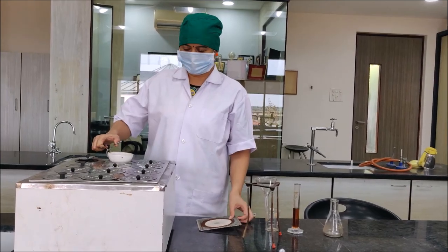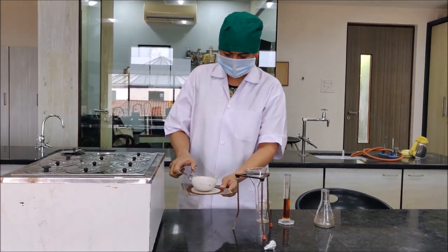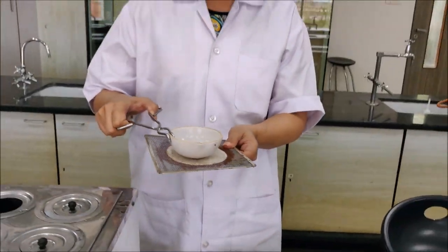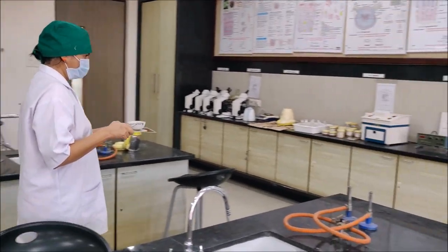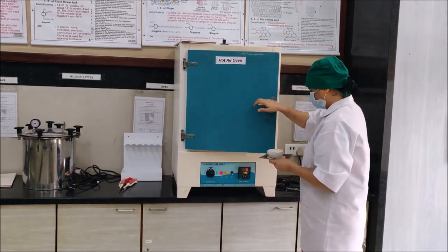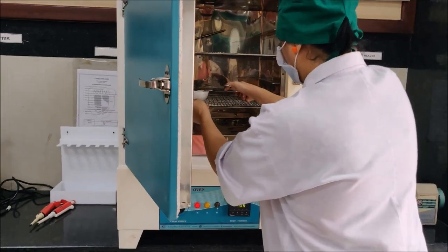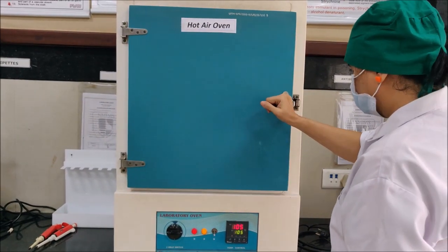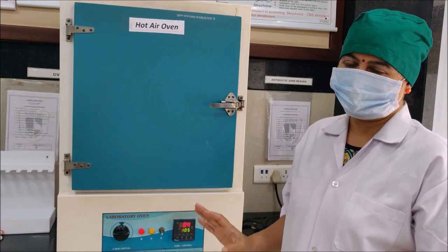As you can see, in the water bath we have already evaporated the extract to dryness. Now we will complete the drying to remove solvent residue in the oven at 105 degrees centigrade. I have preheated the oven at 105°C as you can see — the temperature has raised up to 105 degrees. I will keep it inside for 1 to 2 hours, or until completely dry. Usually 6 hours are mentioned, but you can keep it until it gets completely dry.